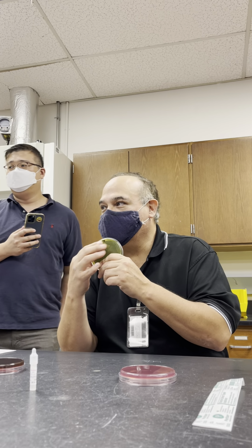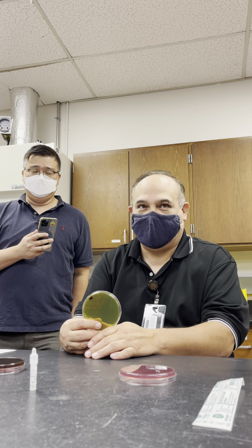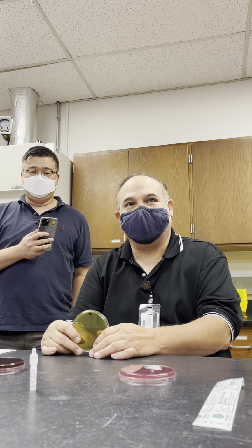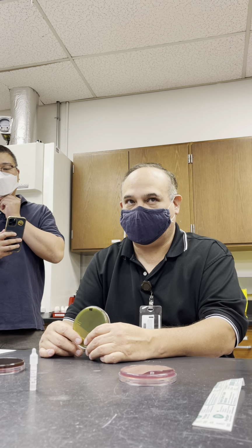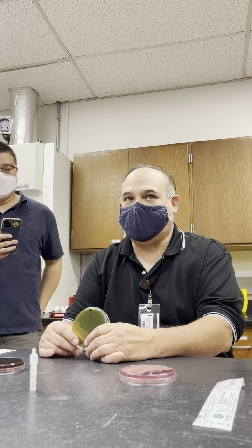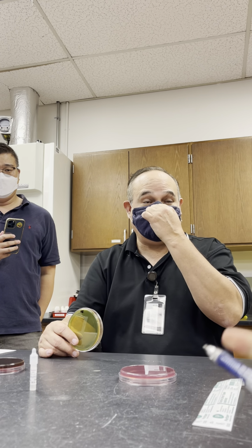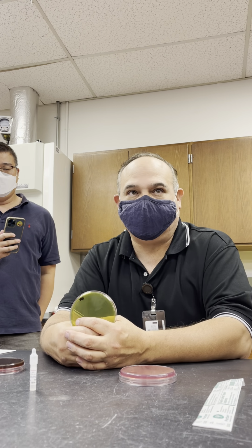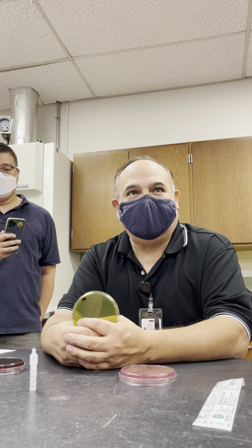Which one is it? This is Hektoen enteric, HE. So check it out. We're going to use this. The application is to test for stools, and what we're looking for here are pathogens. The two big bacterial pathogens in stools are Shigella and Salmonella. So if it's a fermenter, we don't care about it on this plate because we're looking for pathogens, Shigella and Salmonella.